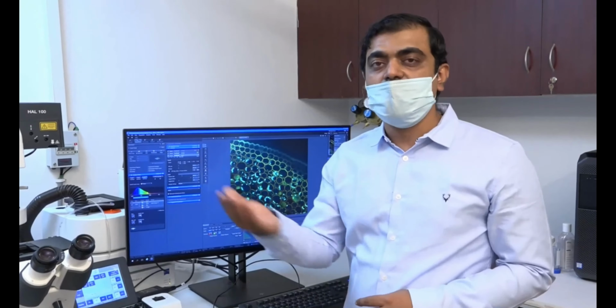So how do we do it? We have optimized these 3 channels. So once we have optimized, we will just take one channel, one track, and based on that we will select a Z stack. So in the Z stack, this window opens up. In this window, we will go in the continuous mode and try to see what the focus of the sample is.